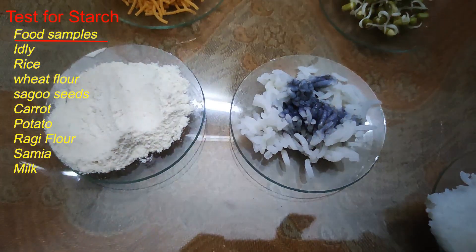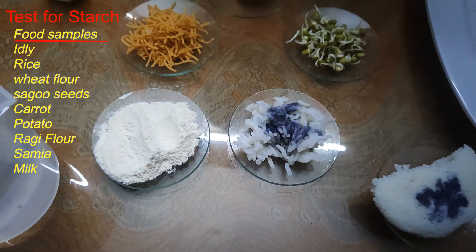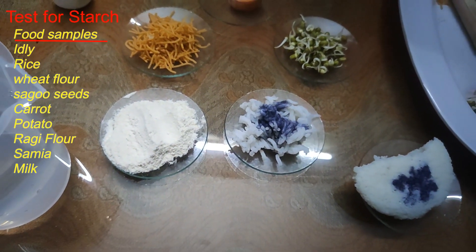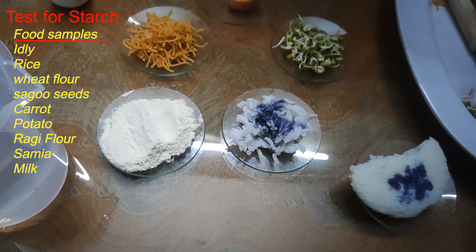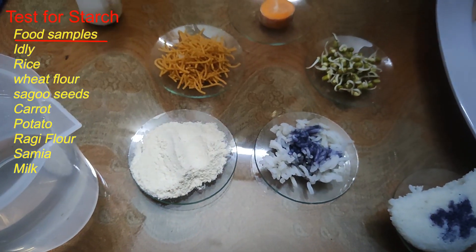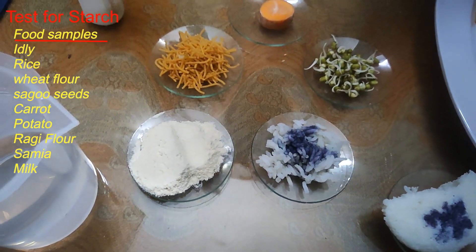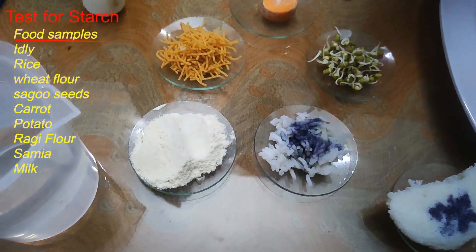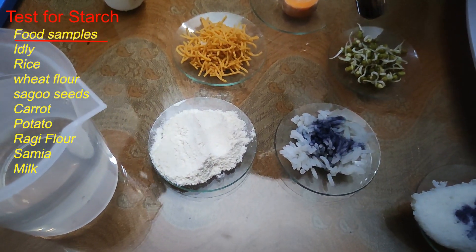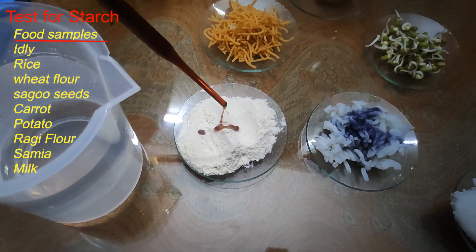The next material is wheat flour — the flour we use to make chapati. We add the iodine directly on the wheat flour. Adding a few drops of iodine, we can observe it turns black color. So we can observe the black color change on the wheat flour as well.